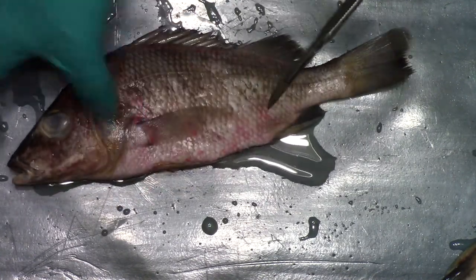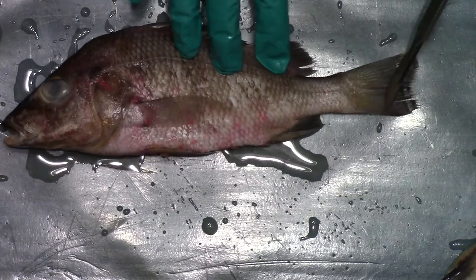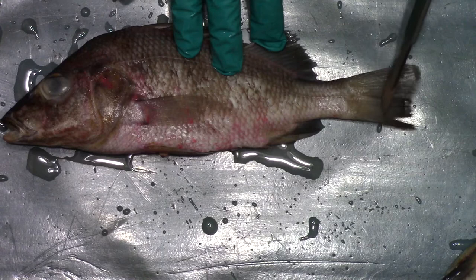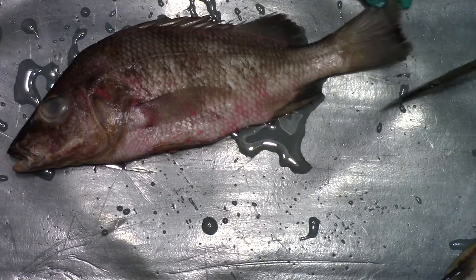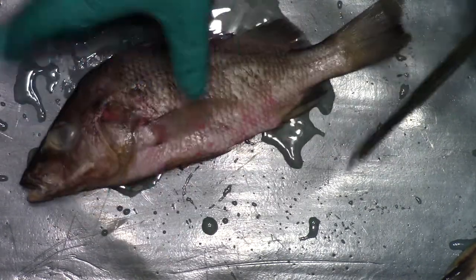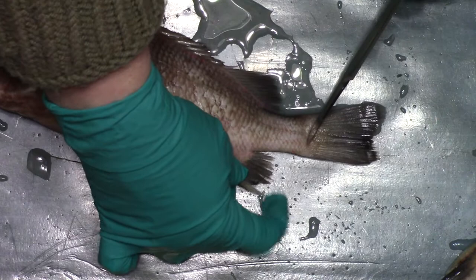These ones would actually stab you a little bit. When you catch fish, you always have to make sure you grab them carefully, because they can be stabby. You've got a caudal fin with that fleshy bit at the end and then the non-fleshy bit that comes out into that sort of fan shape. Then we have the anal fin down here — it's got some spikes, it's quite spiky.